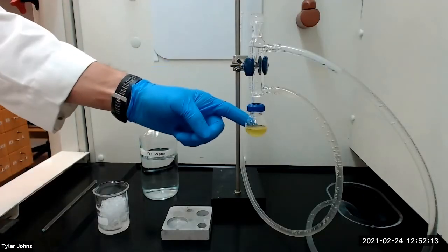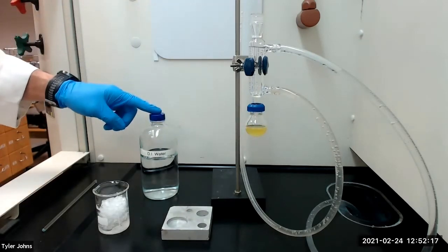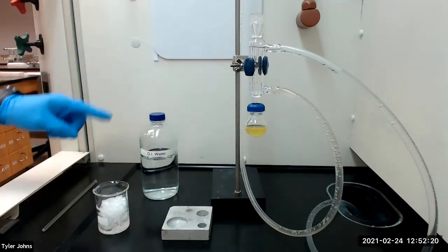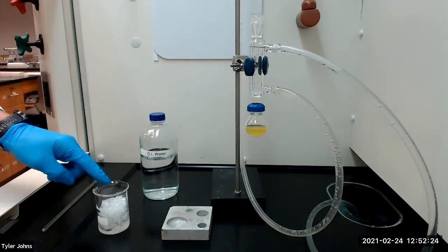After the reflux period and allowing the mixture to cool to room temperature, we will next add 2 milliliters of deionized water and scratch the inside of the flask with a glass stir rod. We will then place the flask in an ice bath for 30 minutes.